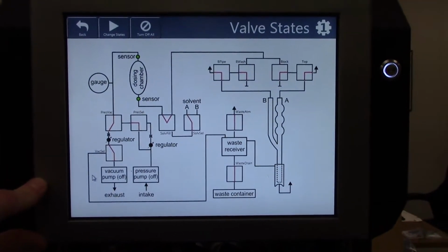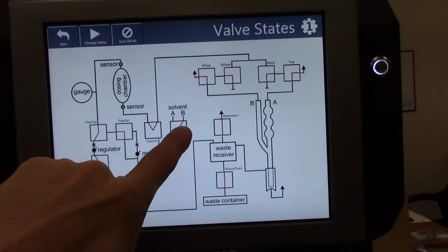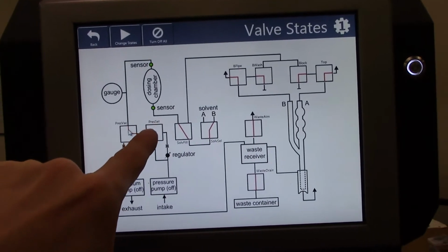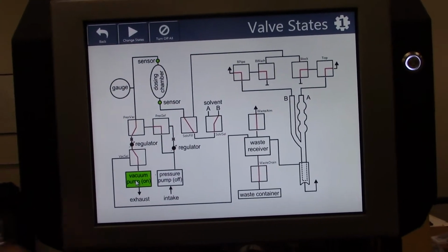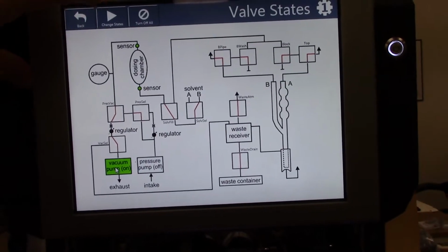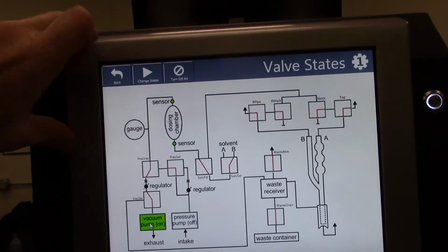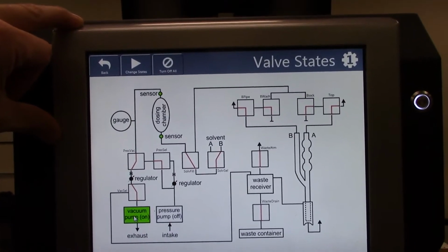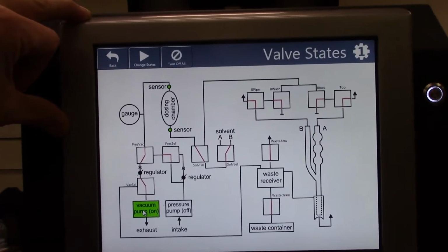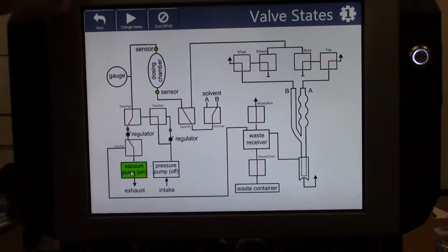Okay, this is critical. We need to draw the solvent B into the dosing chamber. So follow the trace into the chamber, into the vacuum. Now, this is critical. To start it, you must click Change States. You will have approximately 3 seconds before you are able to stop these pumps. So please allow the solvent to fill the dosing chamber completely, a little bit above the indicator, before you stop the pumps. Otherwise you'll have to restart the pumps and it may draw too high.